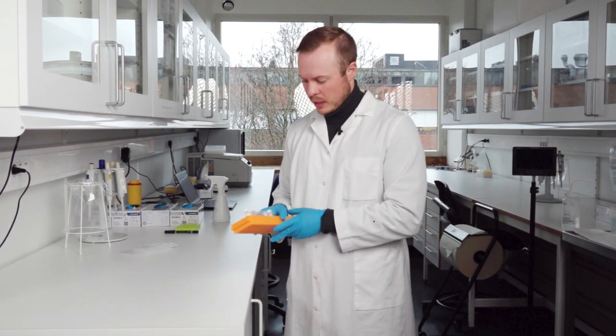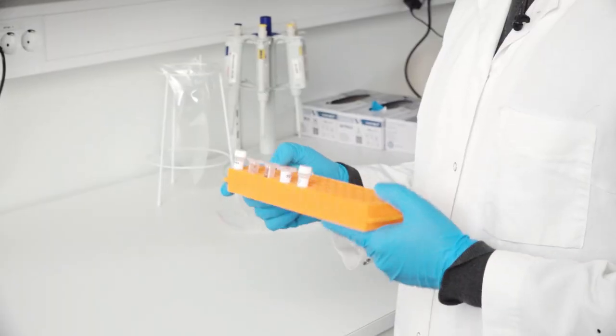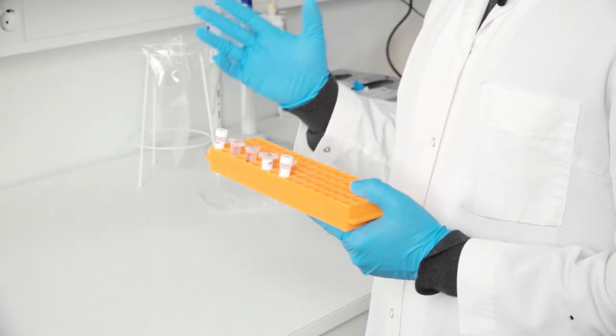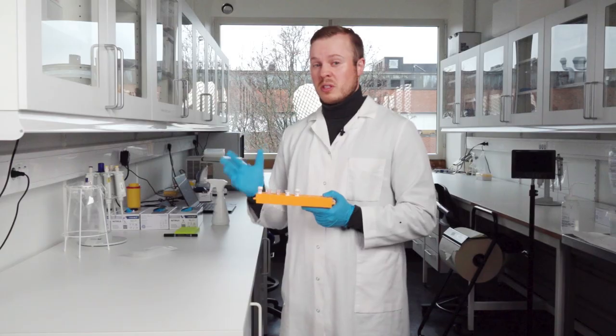So now I have collected all the necessary reagents for making the master mix that is what is doing the job in the PCR reaction.